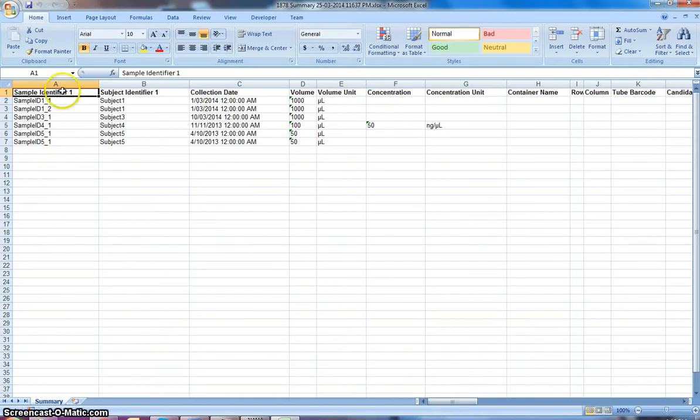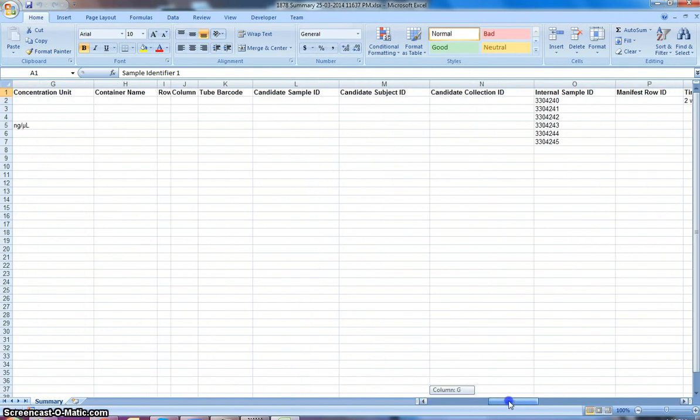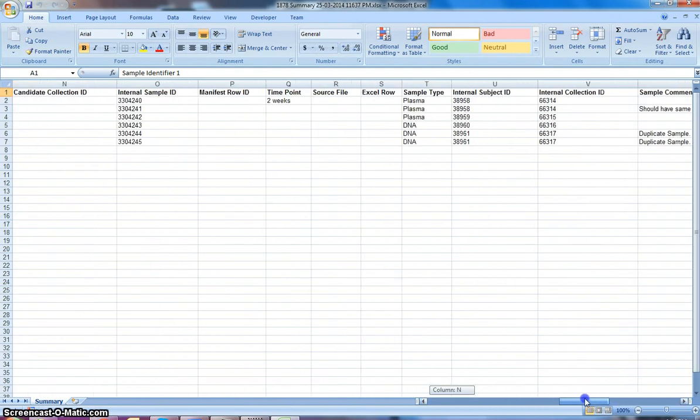It has the information here with the sample identifier, subject, the collection date, your volumes, volume unit, concentration unit, so it's taken the information that's on that screen and assigned an internal collection ID, and also has an internal subject ID and internal sample ID.